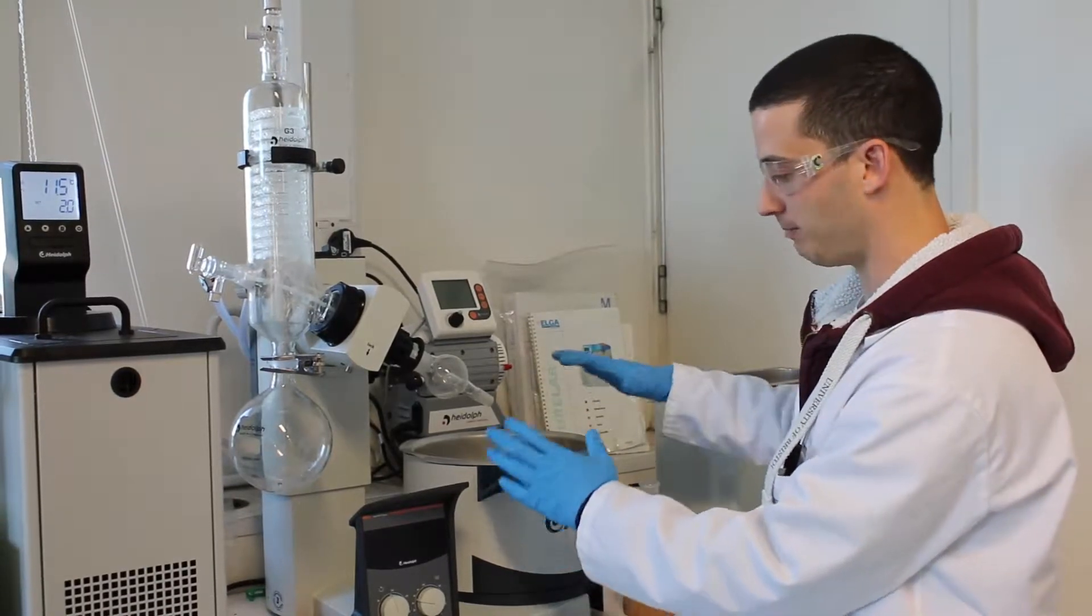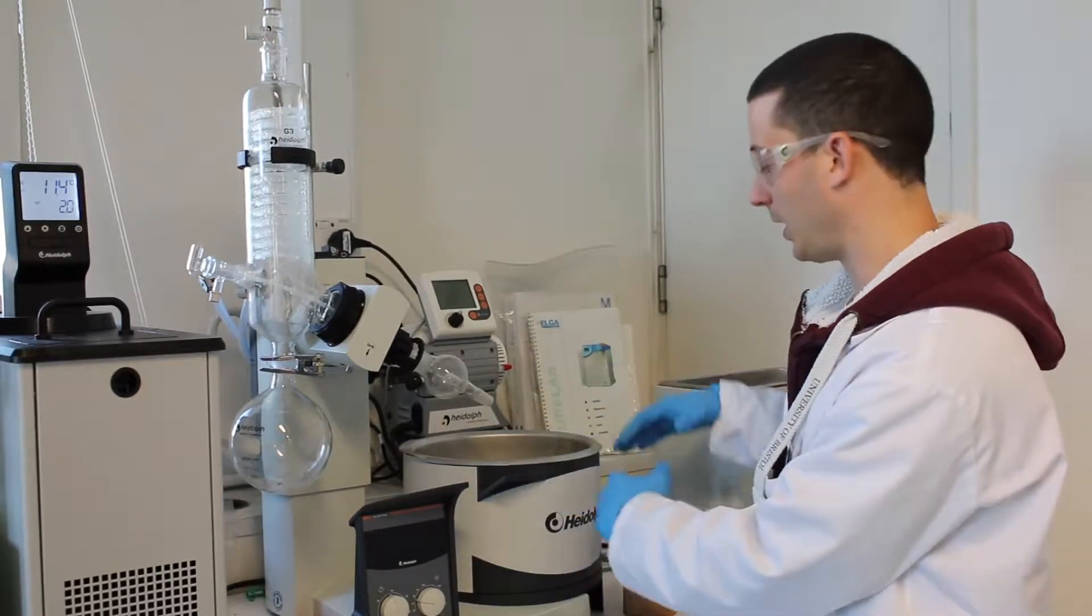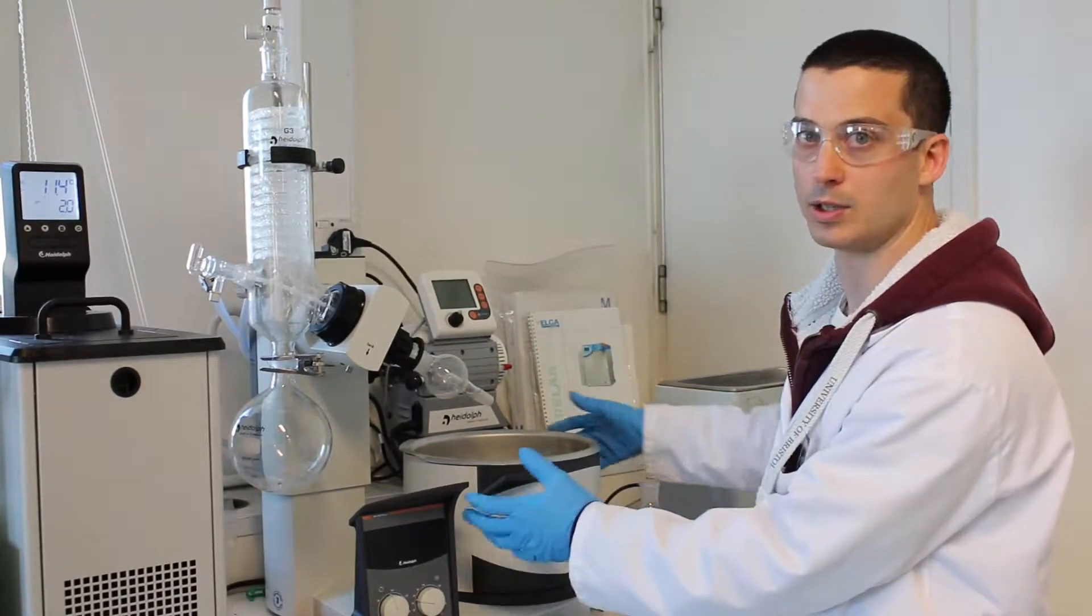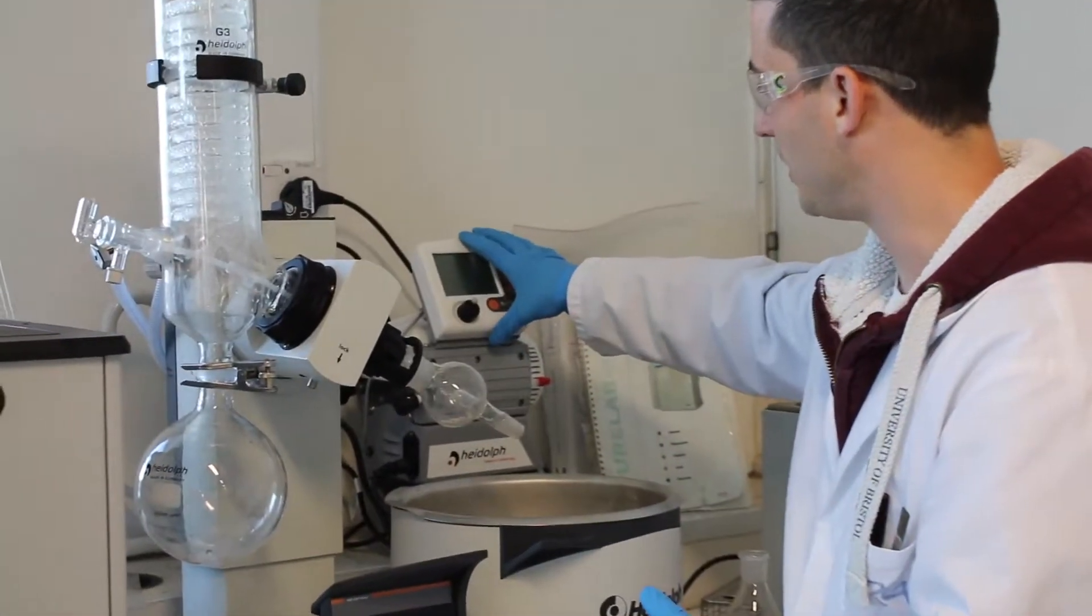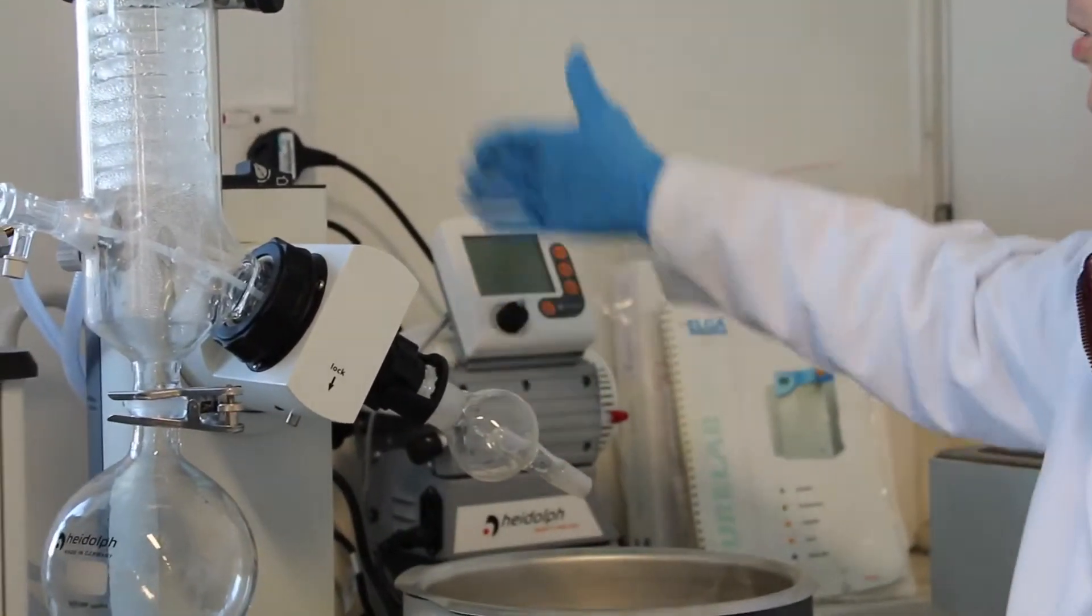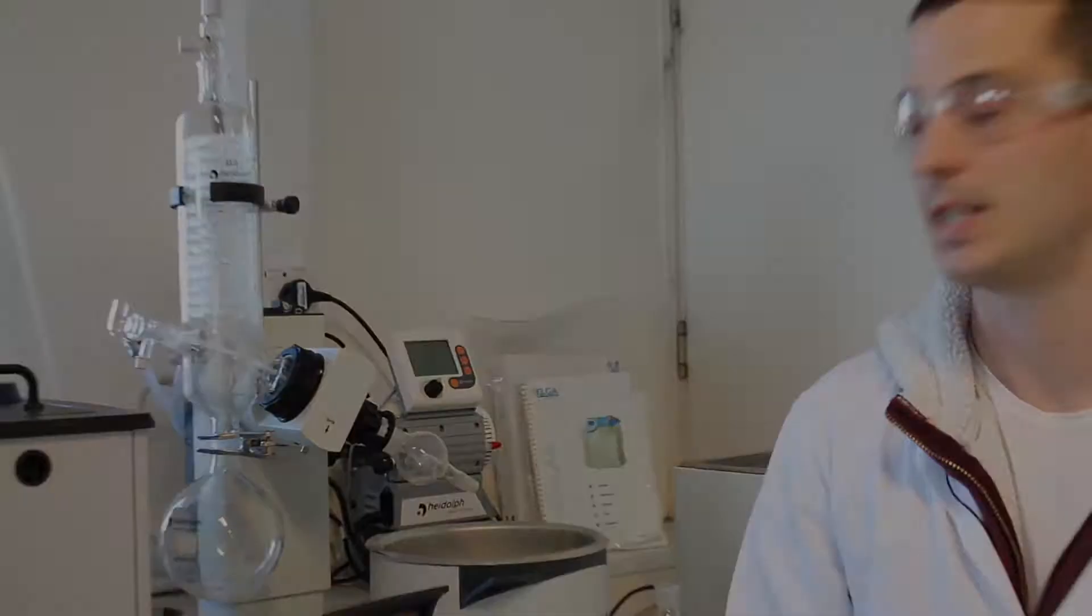Make sure if you need to use higher temperature that the molecules in your solvent are not thermally unstable. And then we have the pump over here that will lower the pressure so we can actually distill out our solvent very easily.